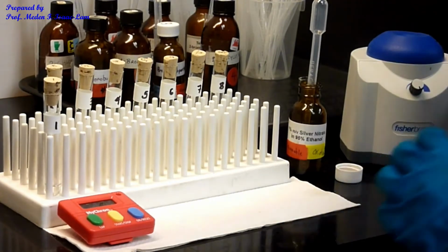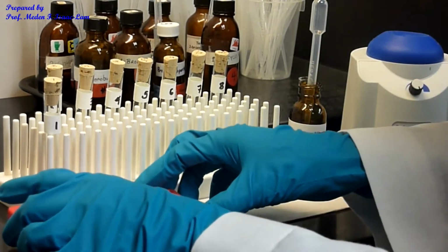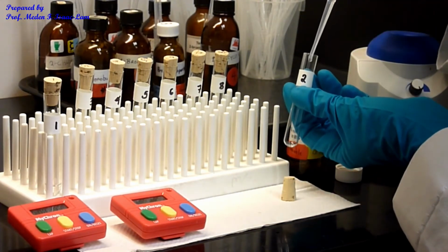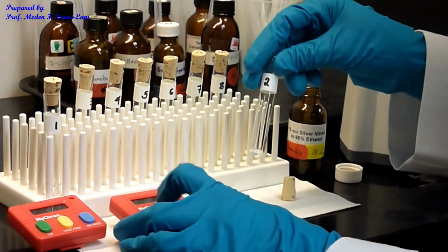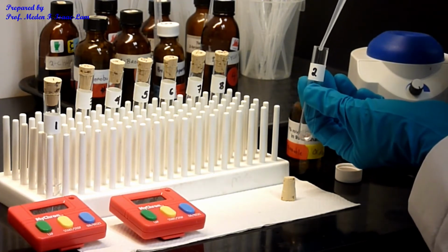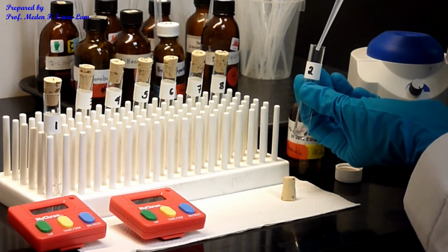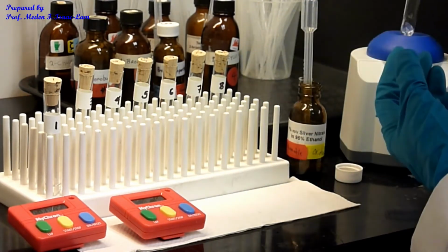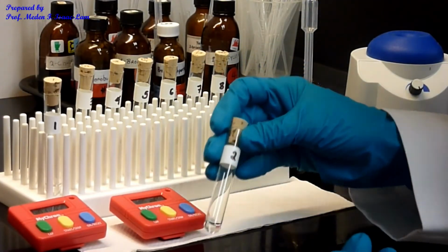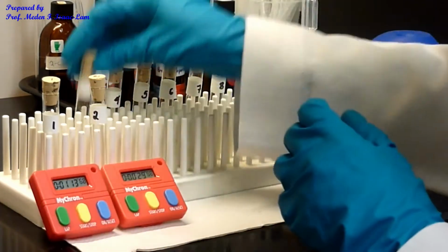Clear? Number 2. Clear? Nothing? Number 3.